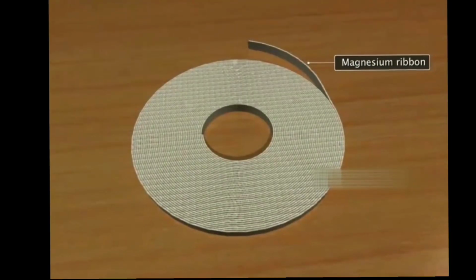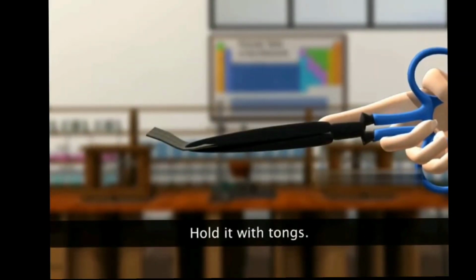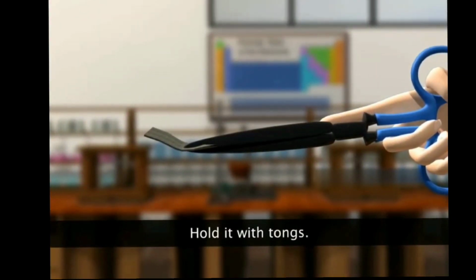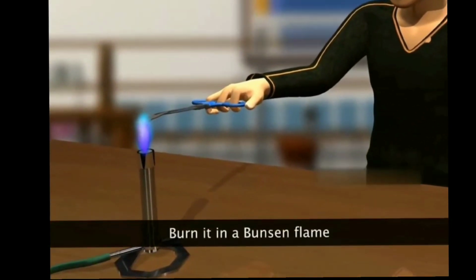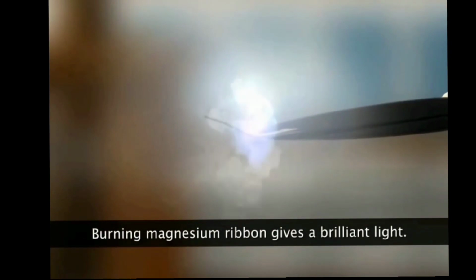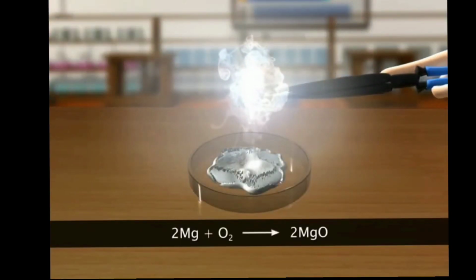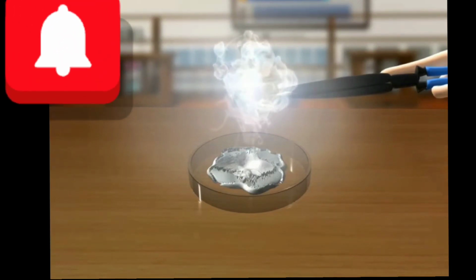Take magnesium ribbon. Cut a piece of magnesium ribbon. Hold the tip of the magnesium ribbon using a pair of tongs. Burn it in a Bunsen flame. The tip of the magnesium ribbon burns with brilliant white light. The ash collected on the tray is magnesium oxide.